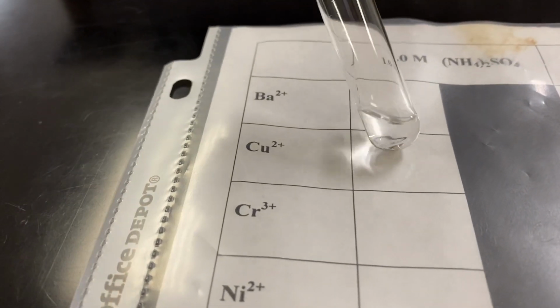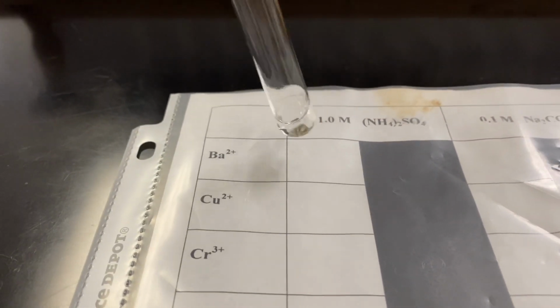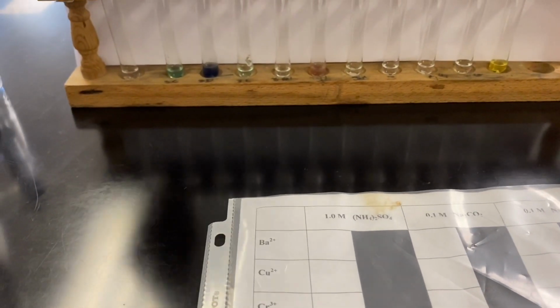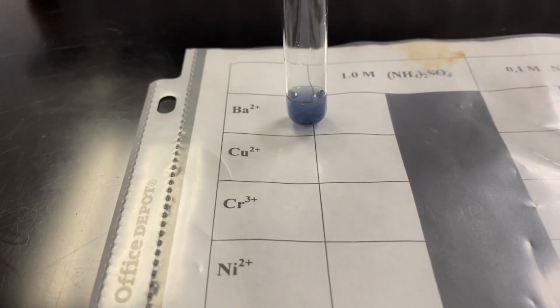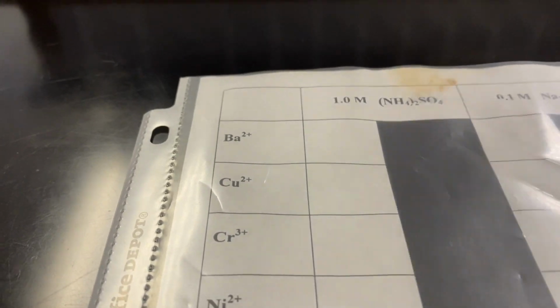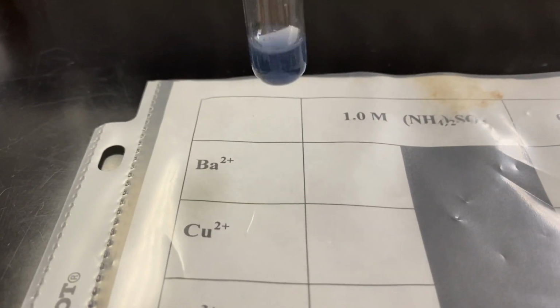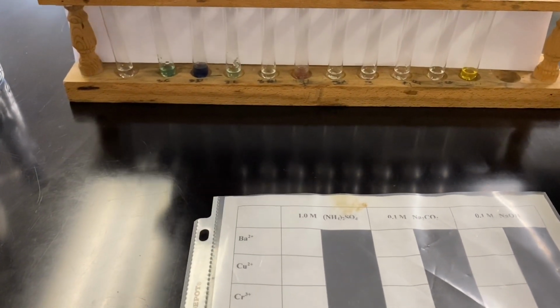In this one, our silvery looking magnesium remains a silvery metal, and the color of the solution remains clear and colorless. That indicates something. This one is a little bit hard to see. However, with better light you can actually see the metal pieces, and there is a deposit like mold growing on top. It's very hard to see because of the concentration of our chromium 3.